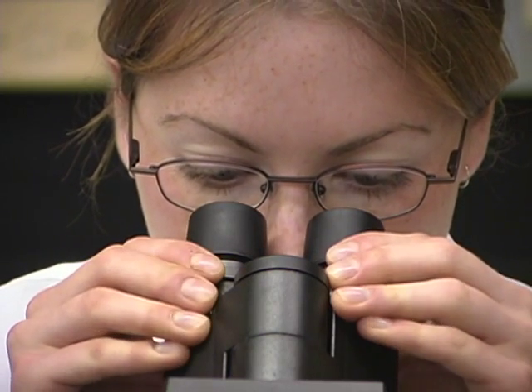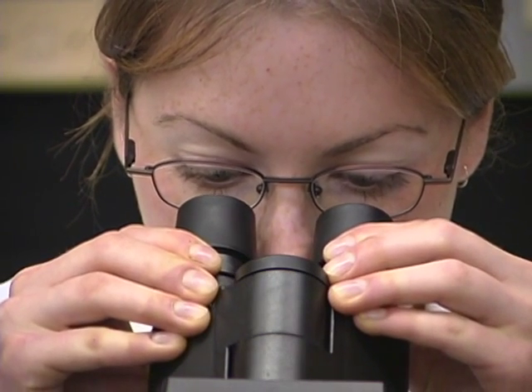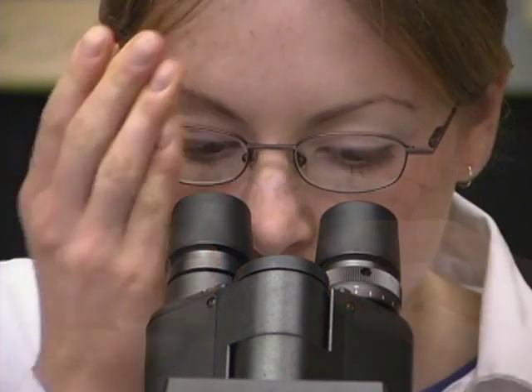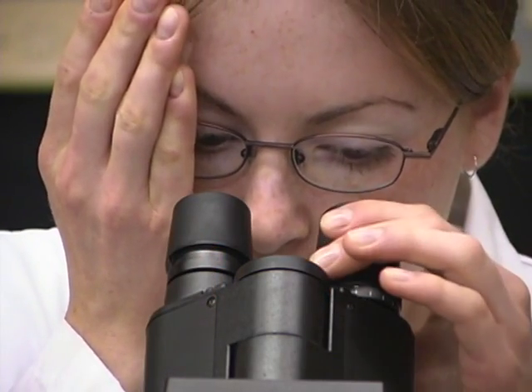Binocular compound microscopes have an interpupillary adjustment mechanism similar to stereomicroscopes. Such compound microscopes also have a diopter adjustment mechanism.